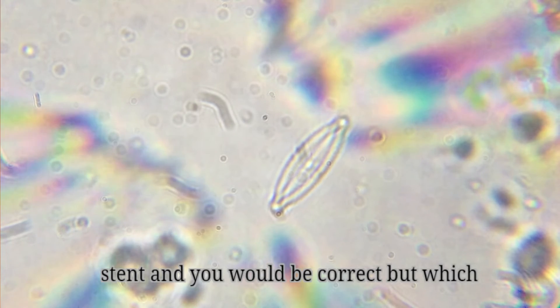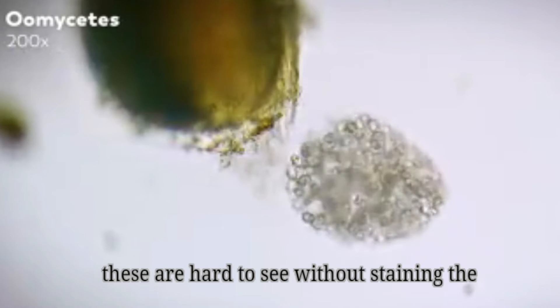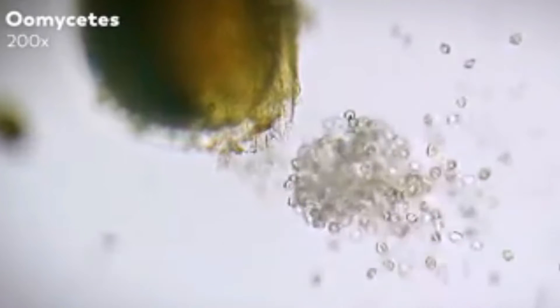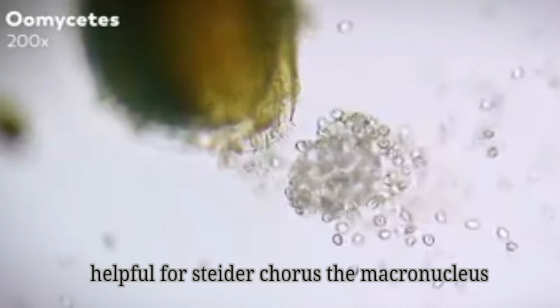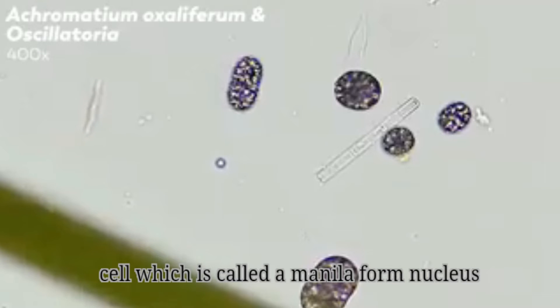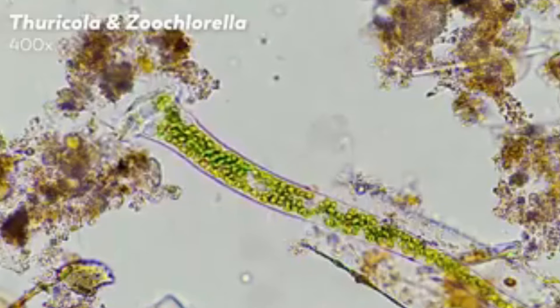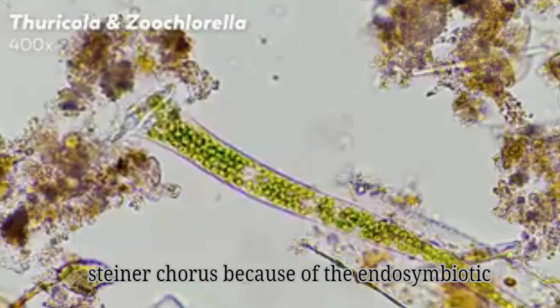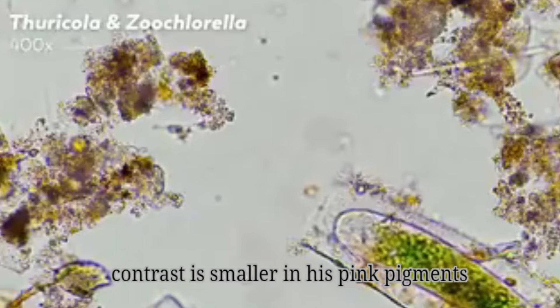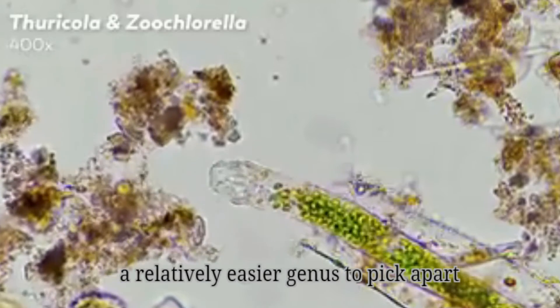For example, what if you see the telltale trumpet morphology in your collection? "Aha," you might say, "that is a Stentor" — and you would be correct. But which Stentor? Stentors have varying numbers of micronuclei, which are hard to see without staining. The macronucleus, however, is visible and can be helpful. For Stentor coeruleus, the macronucleus resembles beads strung together across the cell, which is called a moniliform nucleus. Stentor polymorphus also has a moniliform nucleus, but it's easier to distinguish from S. coeruleus because of the endosymbiotic algae that turn it a green color. Stentor igneus, by contrast, is smaller, has pink pigments, and contains an oval macronucleus.